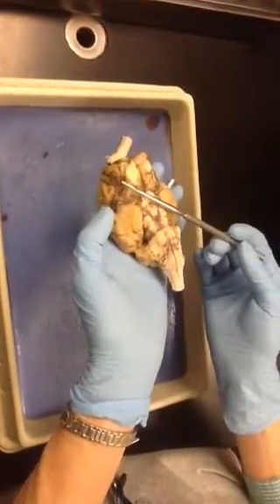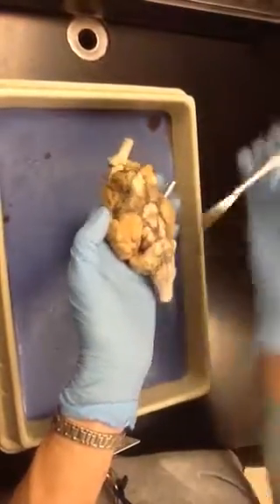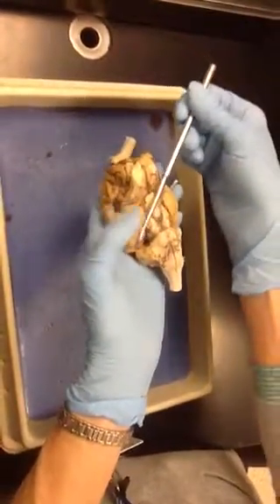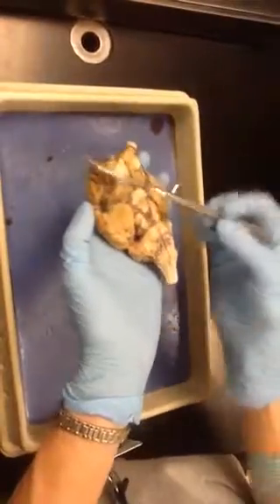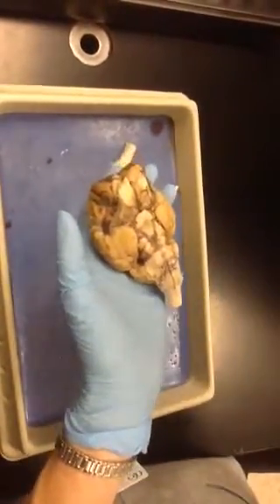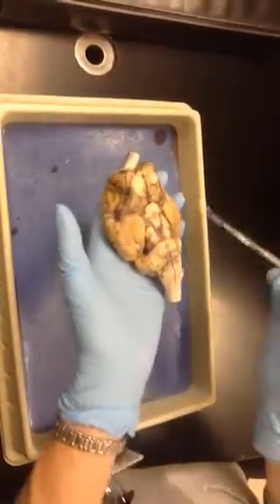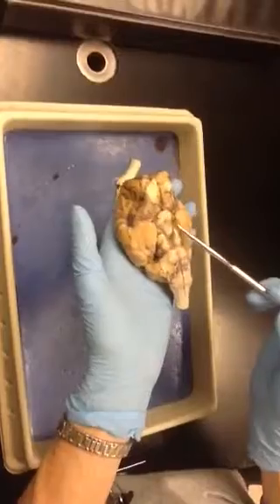Up here is where the optic nerves come in. They've been cut really close here and here, but your optic nerves would come in from this side, would come in and go out this way. From the other side, it would come in this way, right? Because the nerves from the right eye go to the left side of the brain, the left eye go to the right side of the brain. So where they cross over is the optic chiasma.